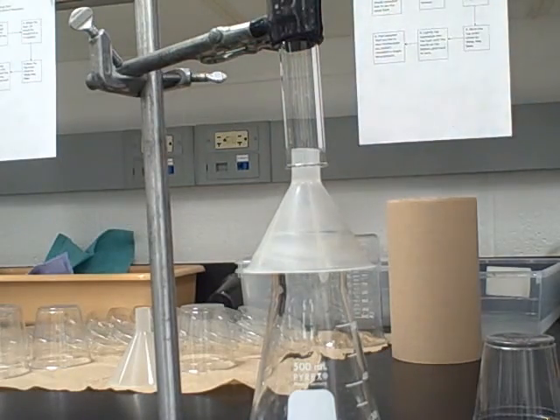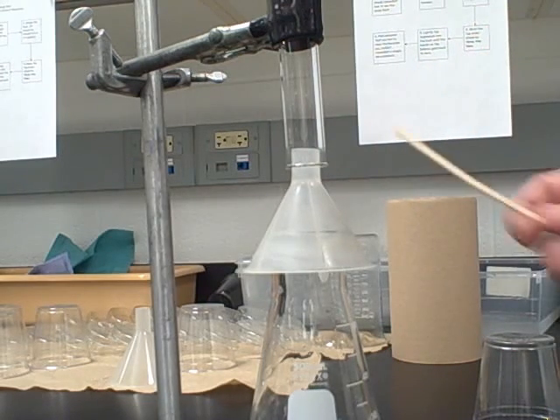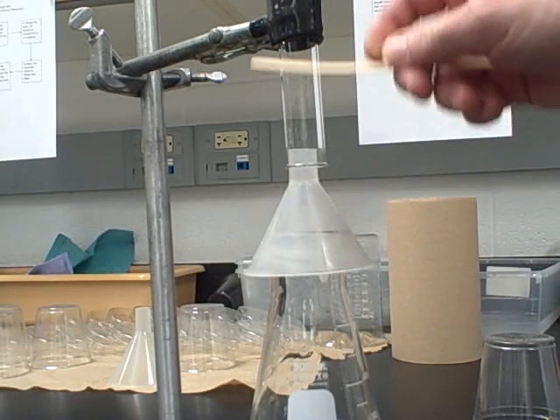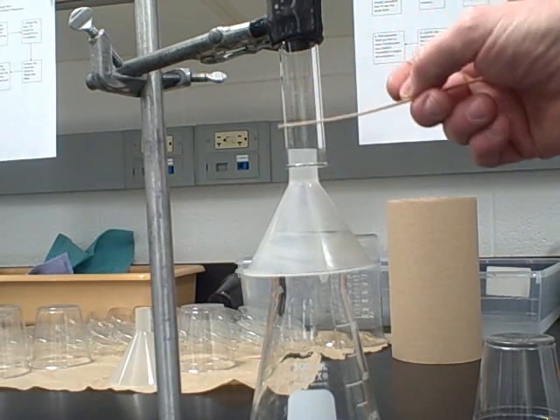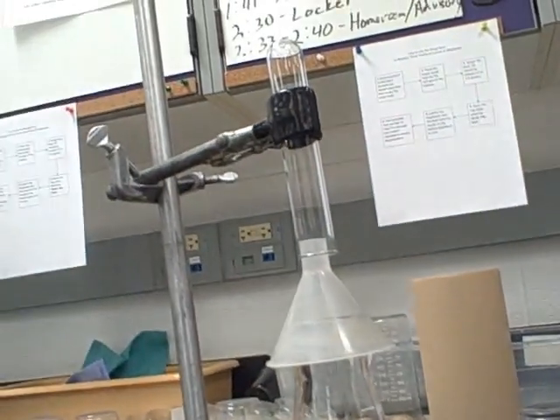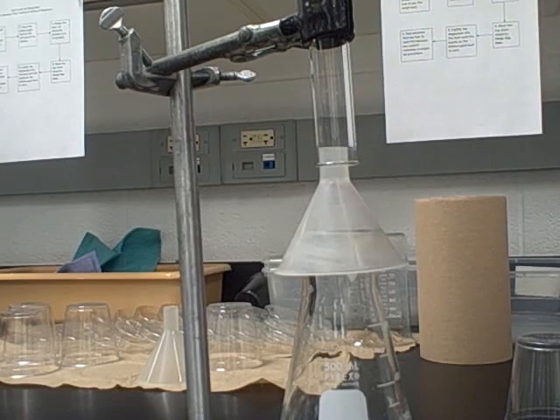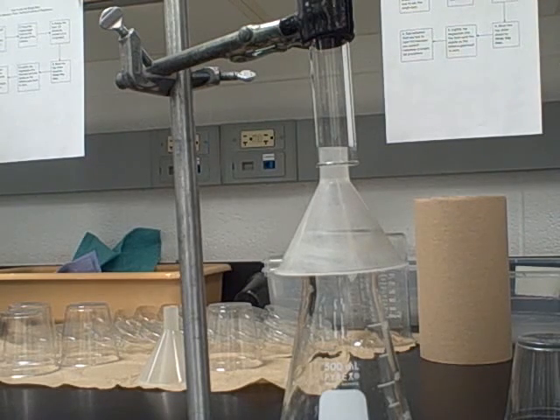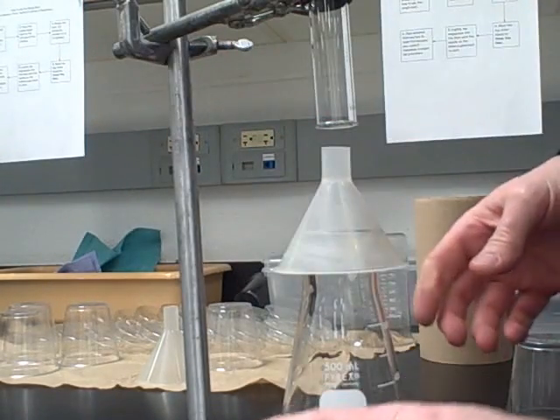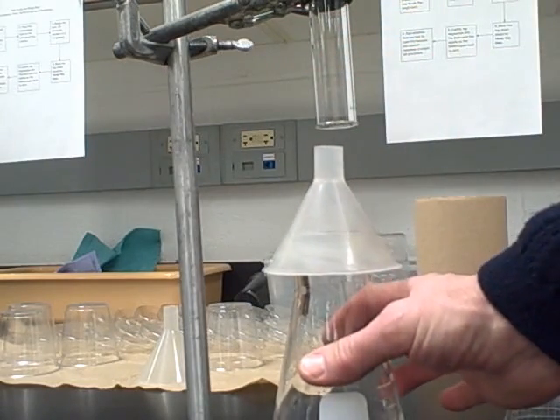Hydrogen gas is even lighter than helium gas — it floats straight up. Make sure you have a little gap under the test tube so that heavier air in the test tube can be pushed out and escape as the lighter hydrogen gas rises and collects at the top. You'll need to work efficiently — not frantically — to make sure this happens quickly enough to collect your hydrogen gas.